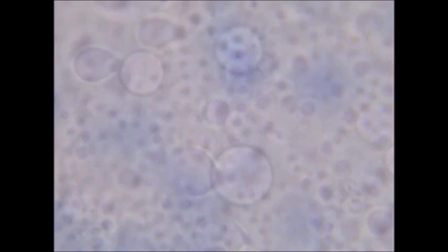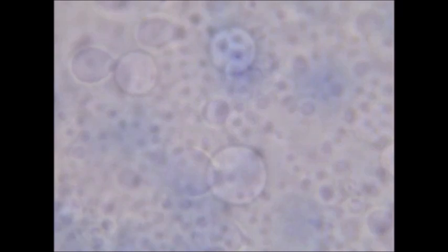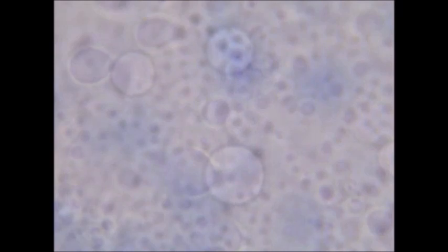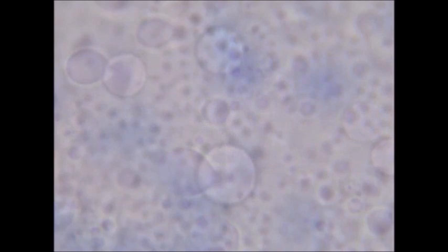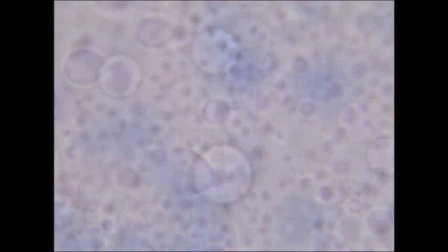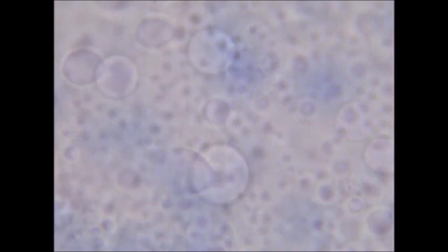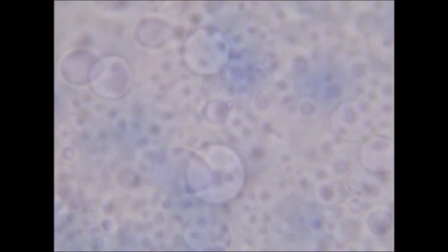And here we have two vesicles of equal size. The one on the right might possibly be slightly larger, and it is proceeding to swallow the one on the left.